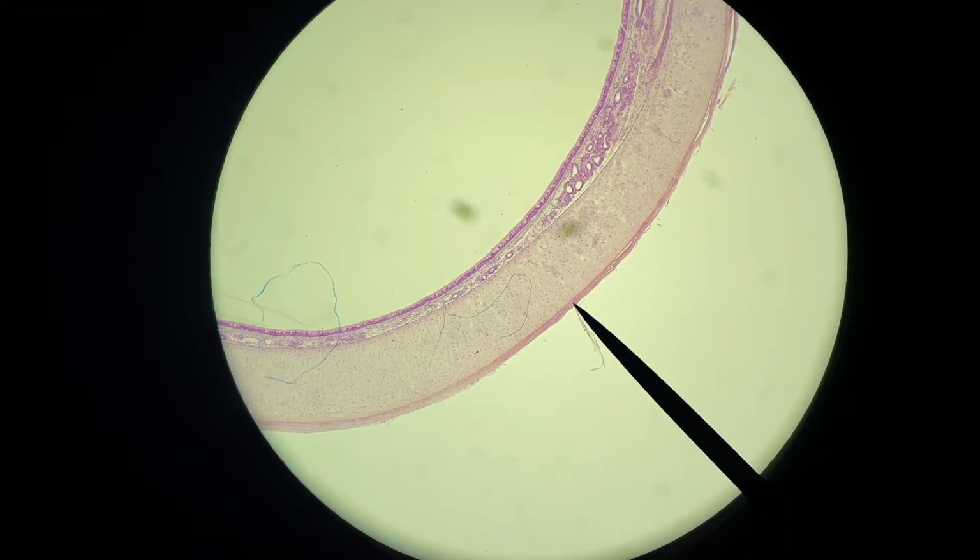But what the pointer is actually on right now is the smooth muscle. So I'm telling you this because I want you to recognize that when you put a tissue sample in and you look at it at the lowest power, I don't want you to assume that the first thing you see is the tissue you're looking for or what you're expected to see. Now, low power might be optimal depending on what tissue type you're looking at. But for this tissue type, it's not optimal. It's just to help us acquire our sample.